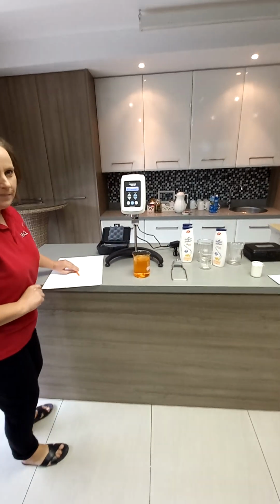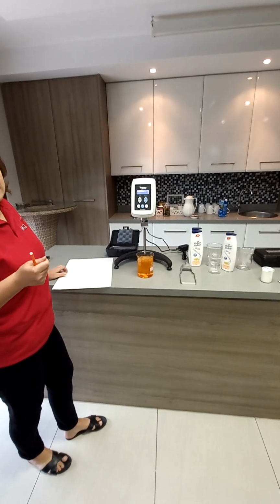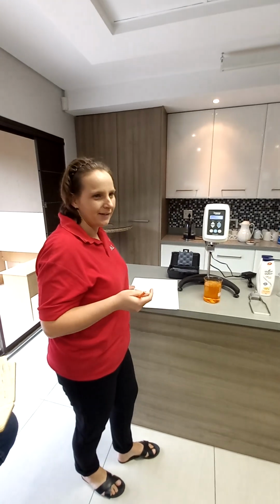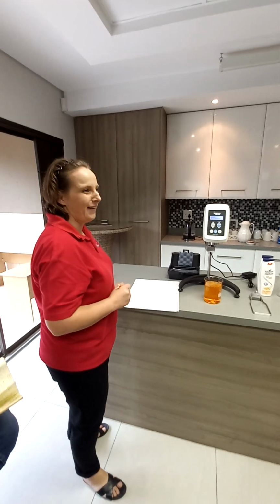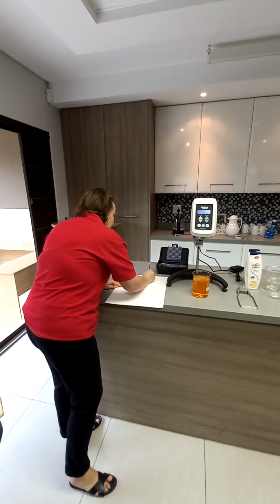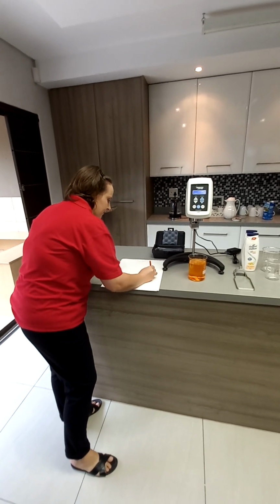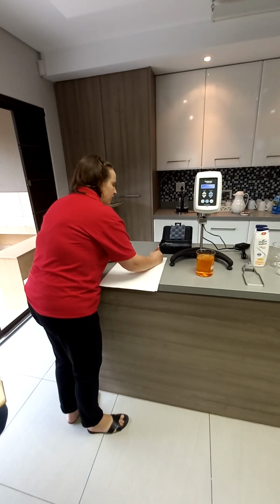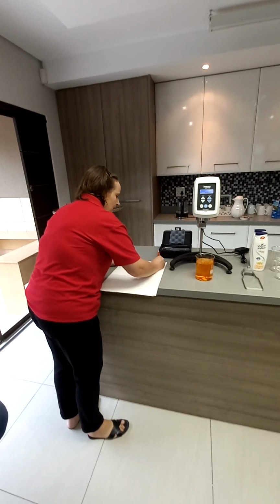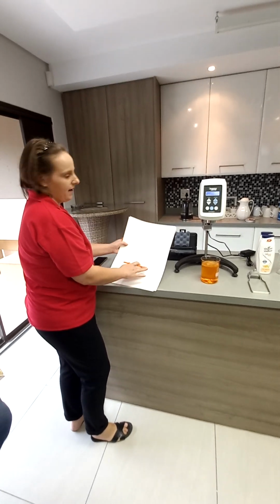Just a little bit of theory: there are 2 types of liquids. We call them Newtonian liquids or non-Newtonian liquids. Have you ever heard of those terms? Yes, but I'm still going to explain. Examples of Newtonian fluids would be water, thin oils, silicone oil, and there are some other products. But most other products are non-Newtonian in behavior.